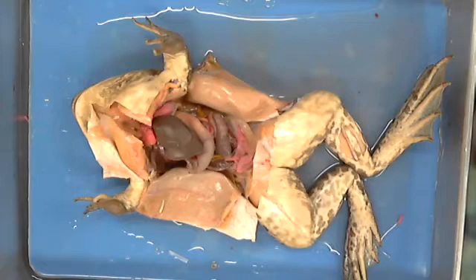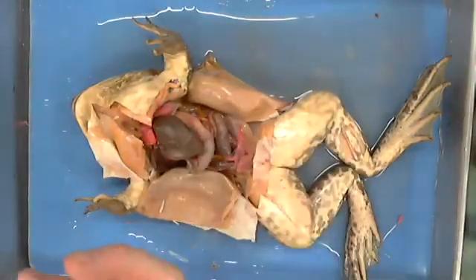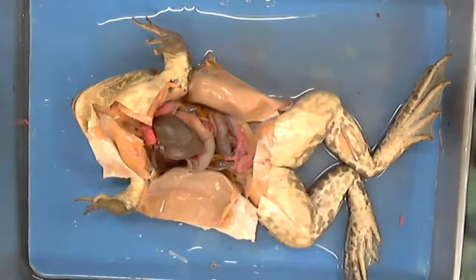I'll change frogs. And when I do, you know dang well that if I'm pointing at the lower portion of her, meaning down in here, and this white, it looks like what a brain would look like if you think about a drawing of a white brain that kind of looks like noodles compacted together. That's what they look like. And then theoretically, you'd see a bunch of black eggs if it was that time of year when she was harvested. That is the only reproductive I'm going to ask you about. I'm not going to pull down and find testes, et cetera, on them, just because typically it's a nightmare to try to find, difficult as far as sizing and those kinds of things.